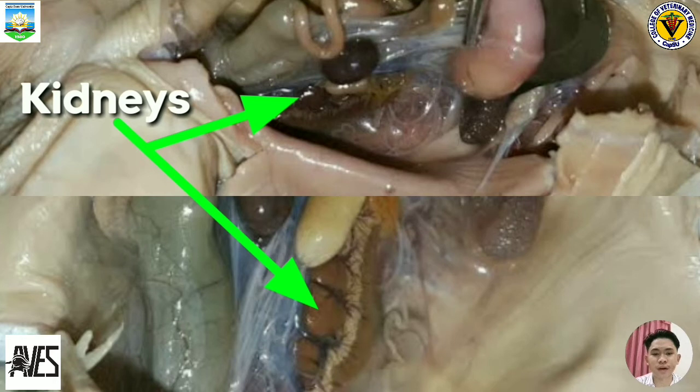The kidneys are organs that excrete urine. Connected to each kidney is a ureter, a tube through which urine passes into the urinary bladder, a sac that stores urine until it passes out of the body through the cloaca. Kidneys are bean-shaped organs located at the lower back of the frog near the spine. They are often a dark color. The kidneys filter waste from the blood. Often, the top of the kidney has yellowish stringy fat bodies attached.